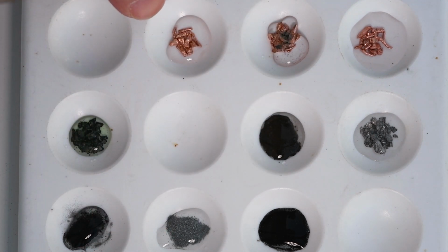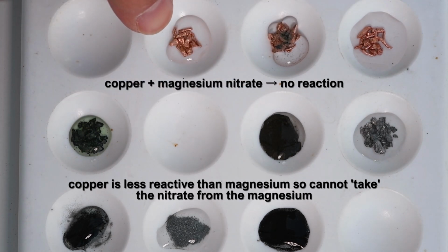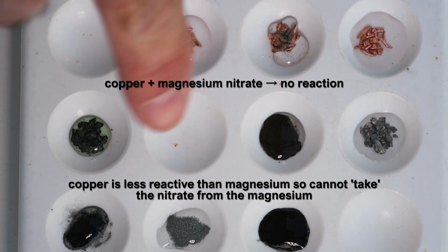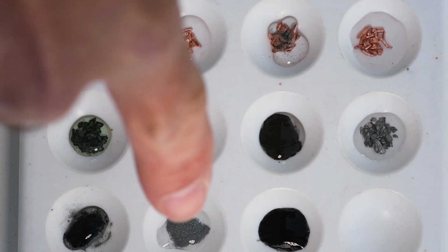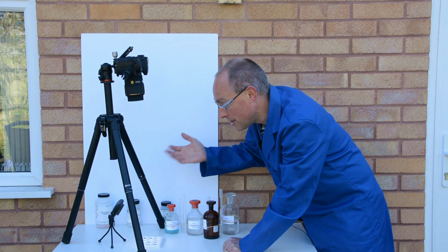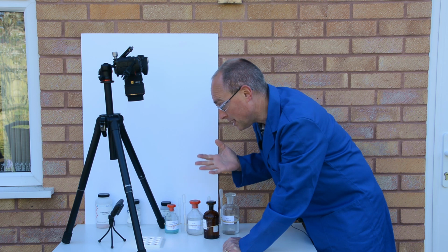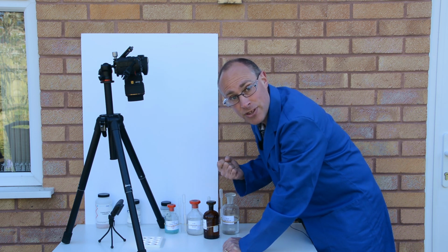In this second column, we've added magnesium nitrate to copper, so magnesium is more reactive than copper, so copper is unable to take the place of the magnesium, so we're ending up there with just the same as we had to start. And again here, with the zinc and magnesium nitrate, there's no reaction there because the zinc is less reactive than the magnesium.